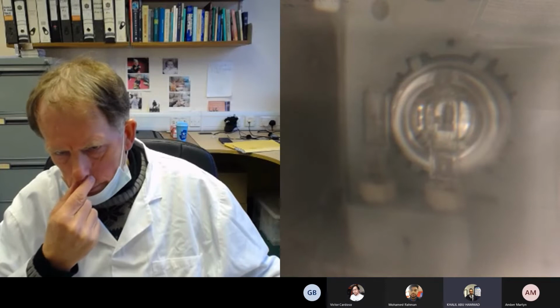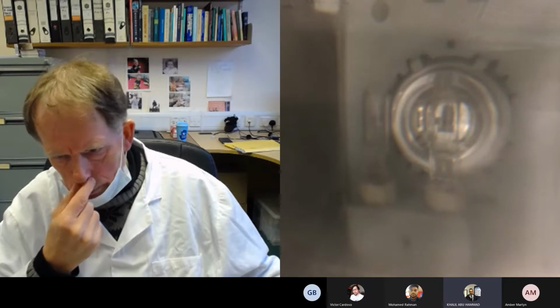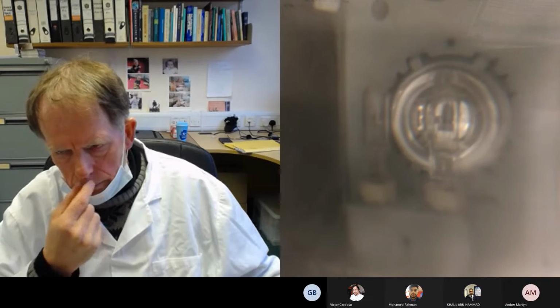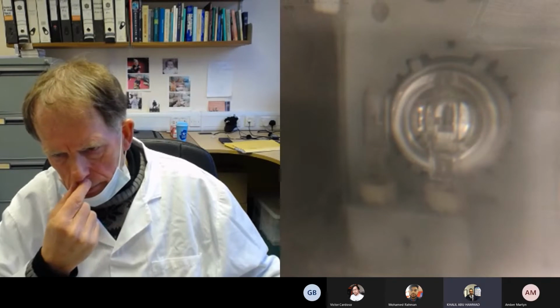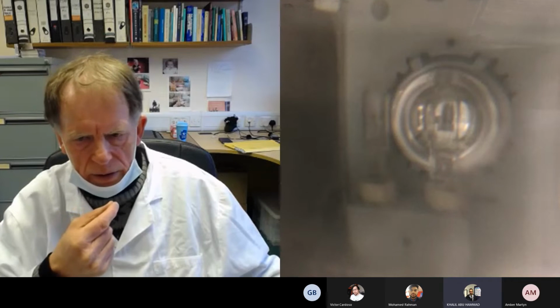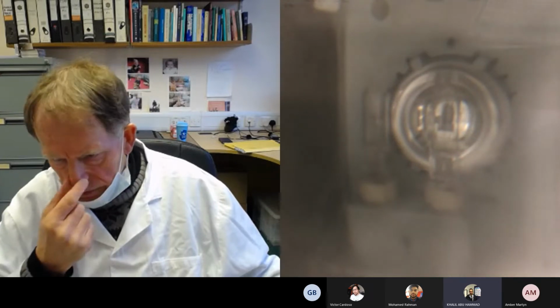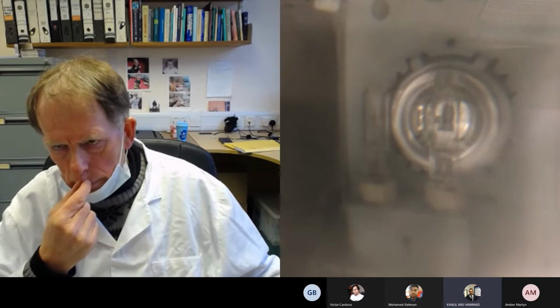Steve, I have a question. Why do we have to choose just 3 samples out of 5? Because those 3 samples had the 11-fold dilution.